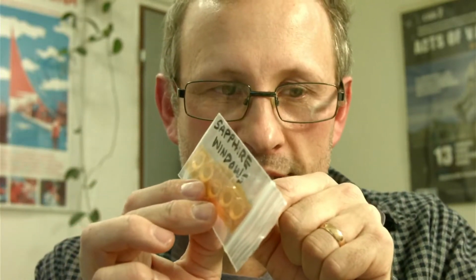He sent these to me, and this will certainly do some protection for this and the optical imaging camera that we're going to be using. However, does sapphire, and this is something I'm asking you, maybe you can find it out, will sapphire affect the spectrum that we can see? It's normally considered a good material for light to pass through. Obviously it's high temperature and clear. But I will need an ND filter, it would seem, based on my experimentation today, so that this device isn't saturated. Okay. Now, I'm going to run through some specs before I show you a live demonstration of this.